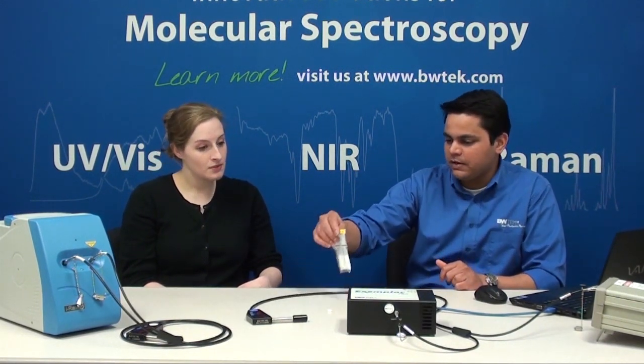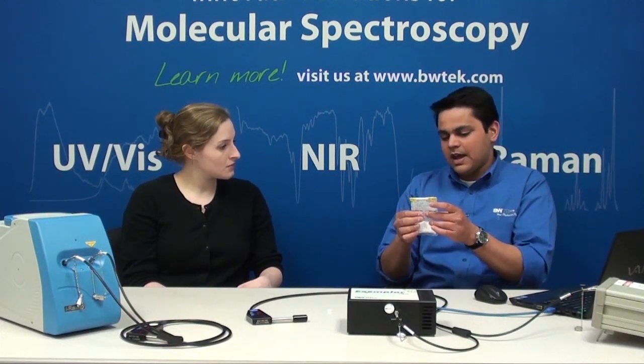So could you explain about reflection and transmission? Sure. When we spoke in the reflection video, we spoke about specular and diffused reflection. We have two similar components here: Rayleigh scattering, which is similar to your specular reflection, and Raman scattering, which is similar to your diffused reflection. And in transmission, let's say you have a packaging material like this polybag over here — if it's thinner than the working distance that the probe focuses the laser on, and if it's transmissive at your excitation wavelength, then you can start measuring the compounds inside the packaging material without it being an interference.